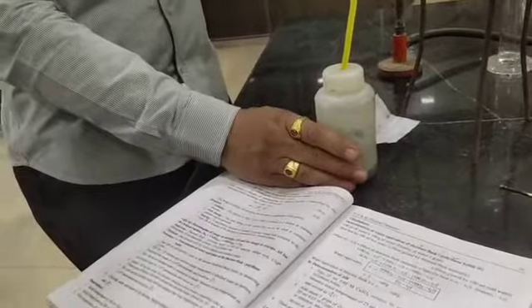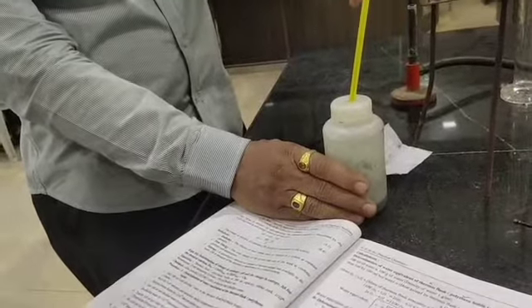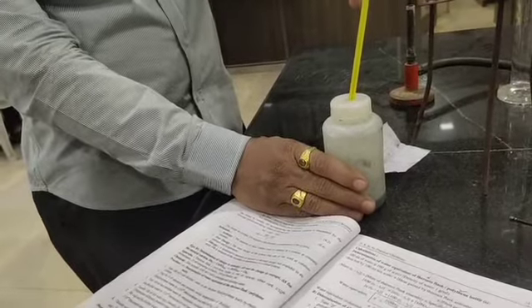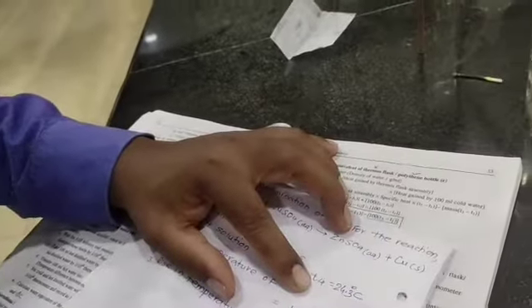It's not increasing now, it stops there. It's constant now. Now it starts decreasing. So the highest temperature we have to write as T5 degrees Celsius, and that temperature here is 26.4 degrees Celsius. So 26.4 degrees Celsius as T5.